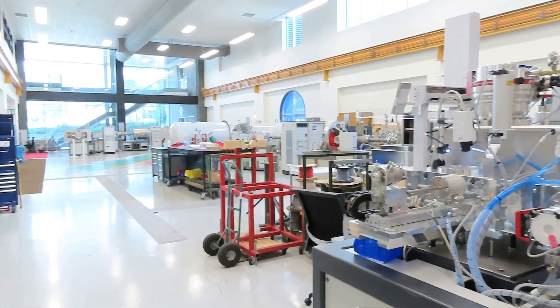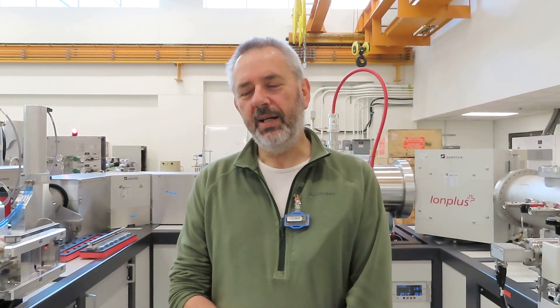My name is Albert Zondervan and I work as physicist for the Lalonde AMS Laboratory here at the University of Ottawa. I will try to give you a flavour of what we do here and what instruments we use for that. In essence, the instruments I will be talking about have to do with mass spectrometry. Mass spectrometry is a very large field in analytical chemistry where you try to understand processes.